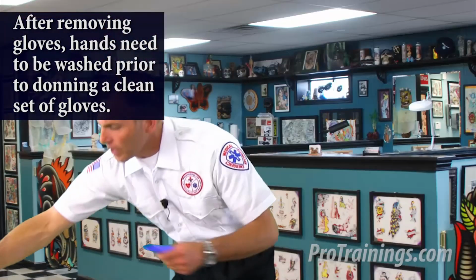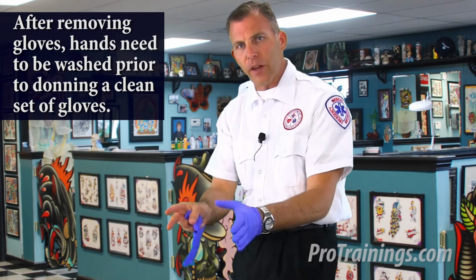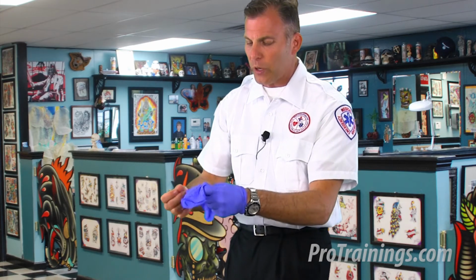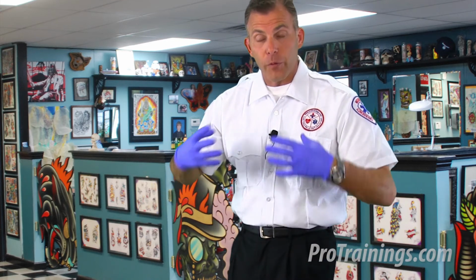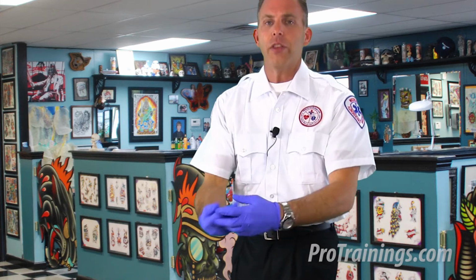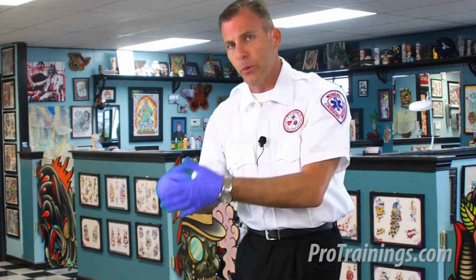And now one more time. I know this seems redundant, but this is so that we're not cross-contaminating between potentially infectious materials and clean items. And that would be the same as if you were grabbing fresh paper towels or opening doors or whatever the case may be, taking off your gown. If you were to take off your gown that might have splash on it, you would take it off with dirty gloves, then take the dirty gloves off, throw them in the trash. Grab another pair of clean gloves, and then take off your face shield with your eye shield and throw that in the trash, and then put on new clean gloves.